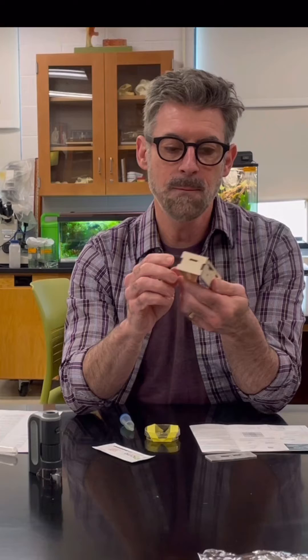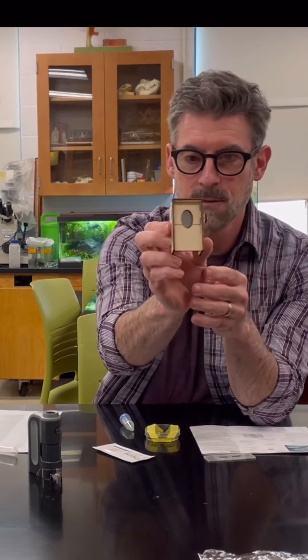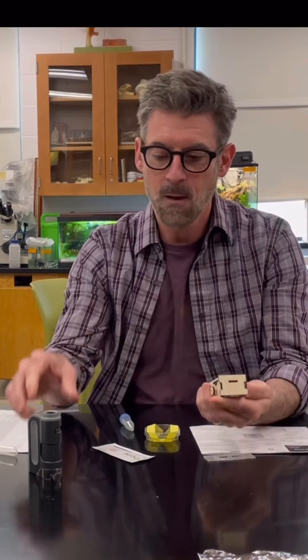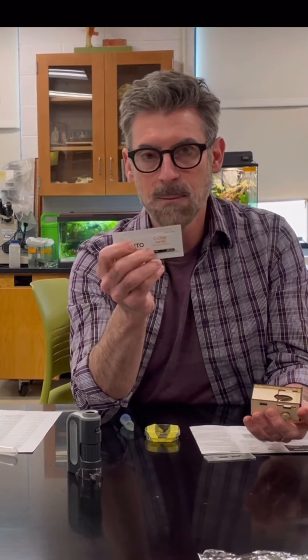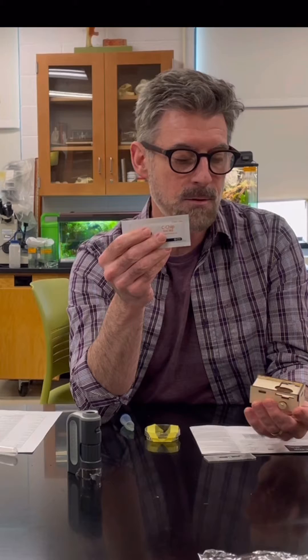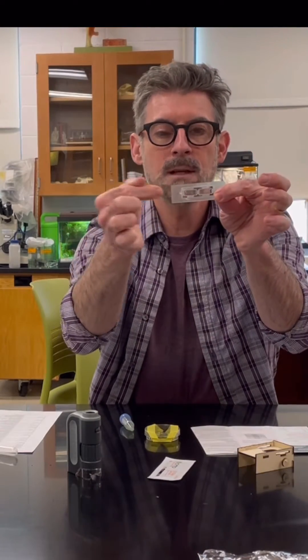In your kit you're also going to have a little stage that I designed and cut out with a wood laser cutter. We attached a mirror on the bottom, and there's a knob on the side so you can angle the mirror - that's going to help you reflect the light back up at your slide so you can see better. In your kit you'll also have a counting slide called a C-chip, essentially a hemocytometer. It's a slide that has etched grids on it and the cover slips are already attached.